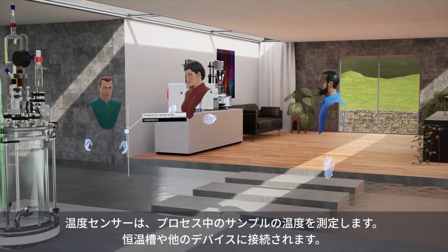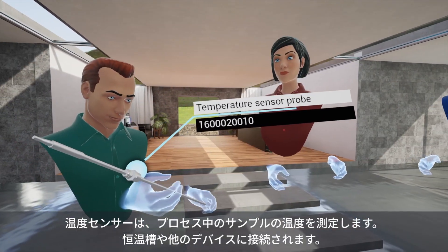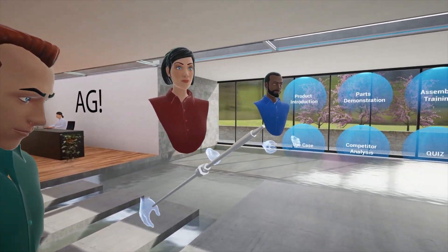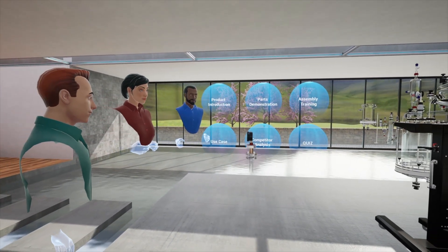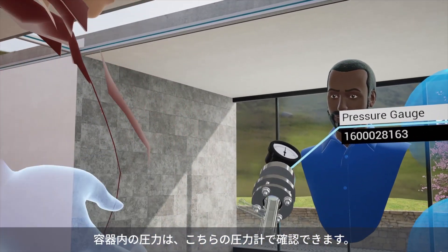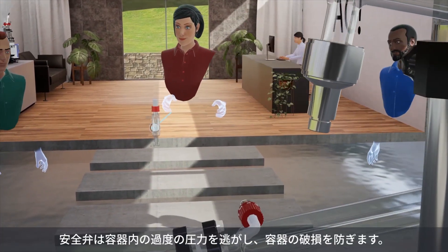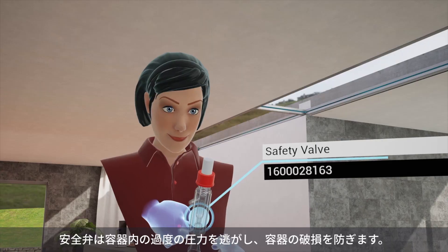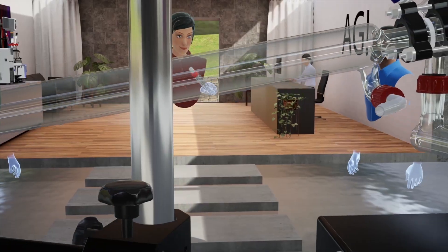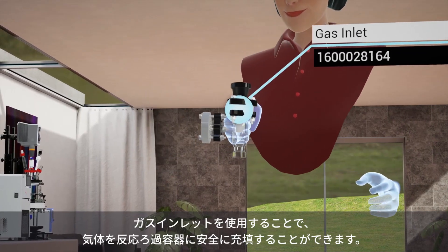The thermal probe is used to monitor the process temperature. It should be connected to a thermostat or any other suitable device to read the signals. The pressure gauge helps to monitor pressure within the process. The safety valve releases excess pressure in the vessel and prevents damage. The gas inlet helps to fill the reactor with desired gases safely.